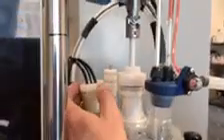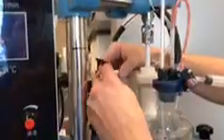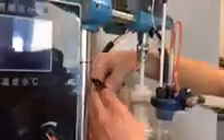We have a split plug design. We were not allowed to cut our probe wires, so I'll show you how this actually works. We actually made a split plug design, which is out of rubber, and as we push this in here, now we can remove the probes, add new probes, whatever we need to do. Over here, we've got the primer sampler system that we've designed.